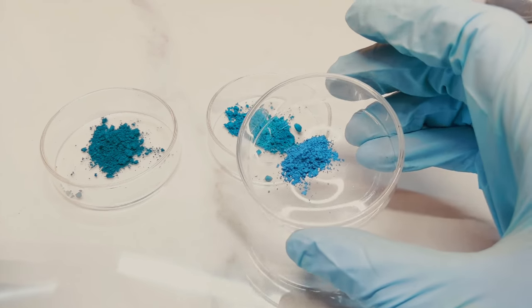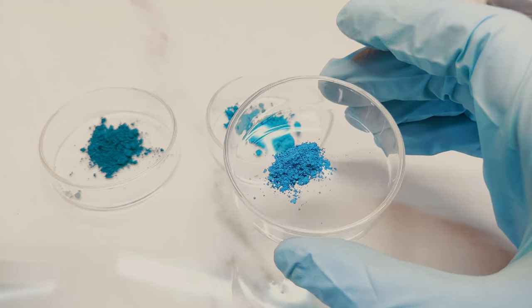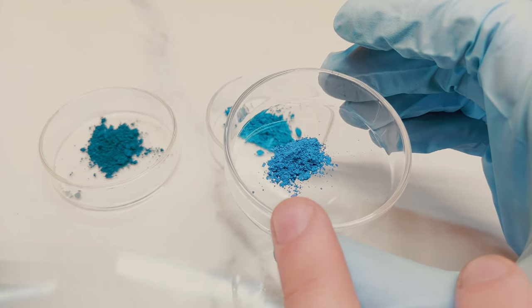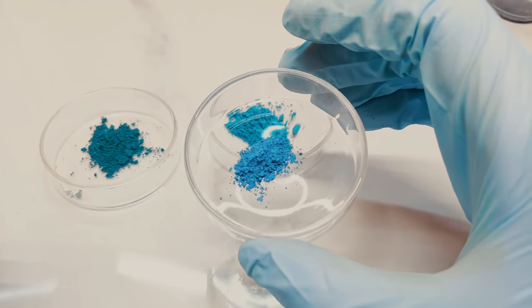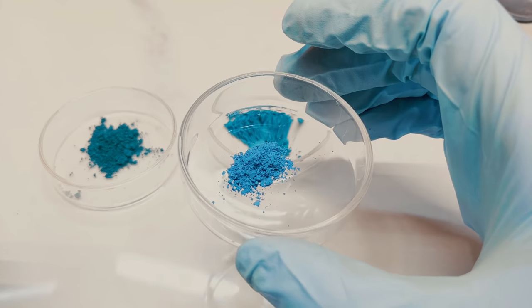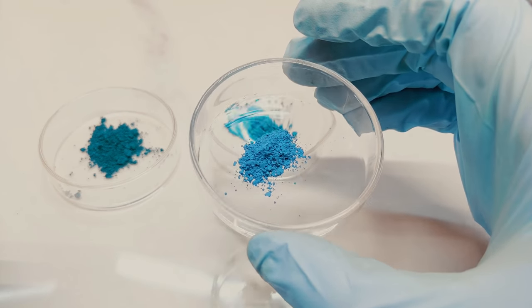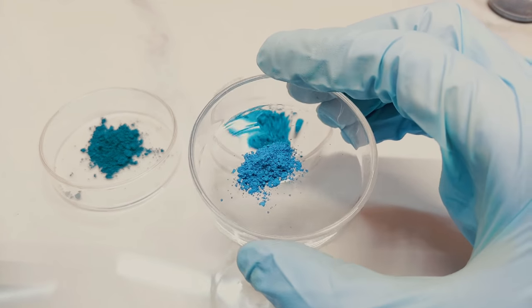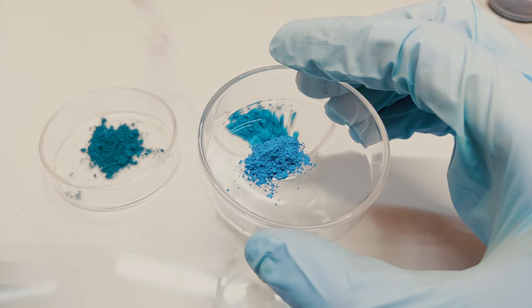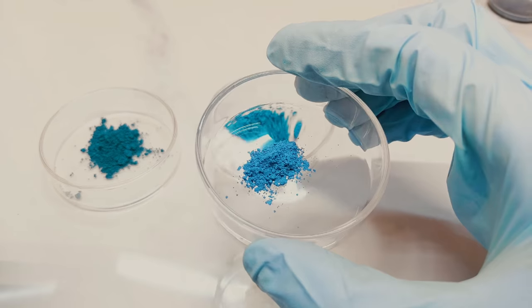The last little sample here on the edge was our zinc and aluminium mixture. This one is interesting because it's a lot bluer than the others and a lot less green, but it still has more of a turquoise teal shade than the original cobalt blue from part one. Later I'll do a comparison of all the cobalt pigments. This gives me hope because it means I'll be able to play around with the ratios of zinc and aluminium to cobalt and tilt things from green to blue.